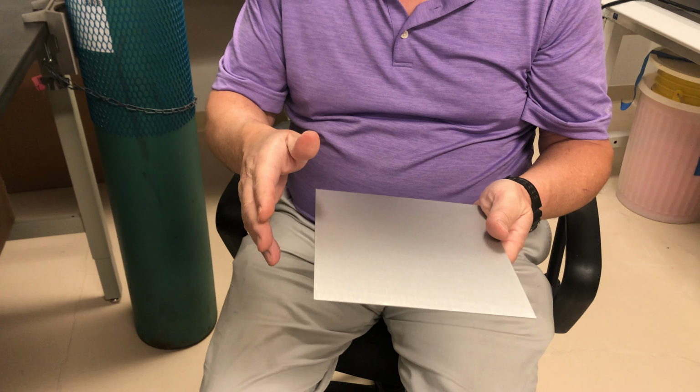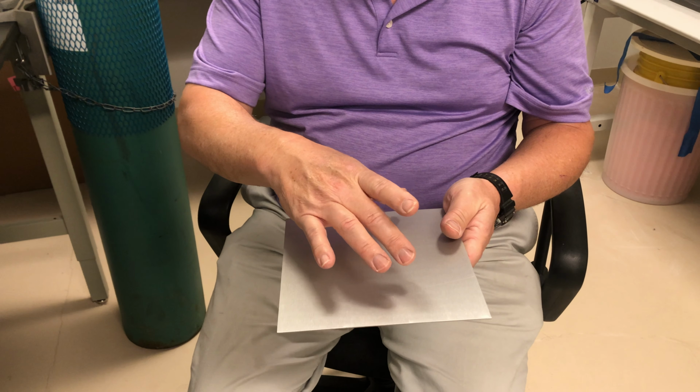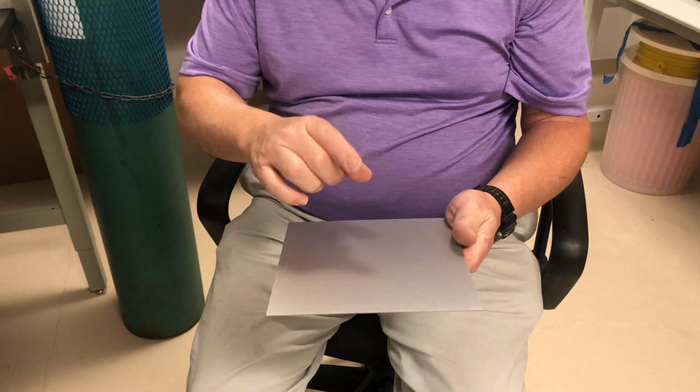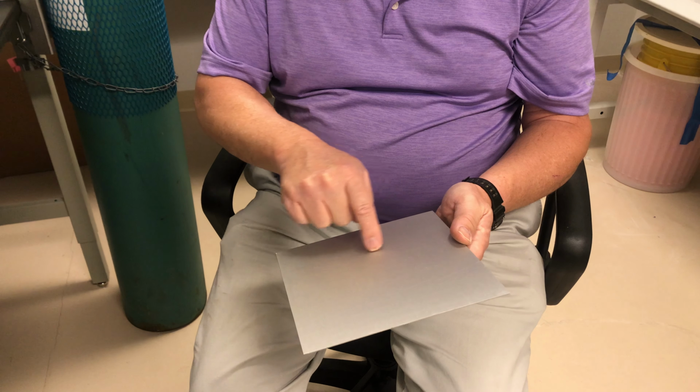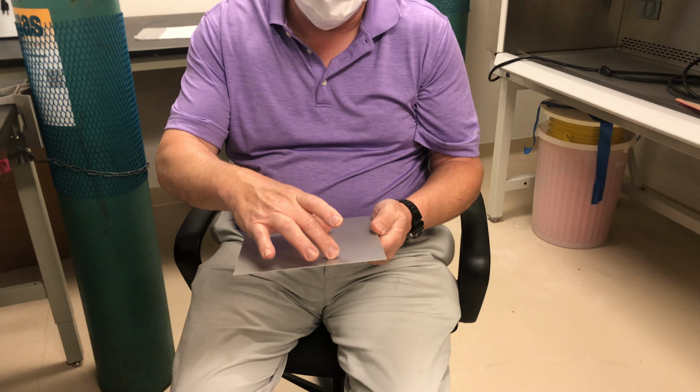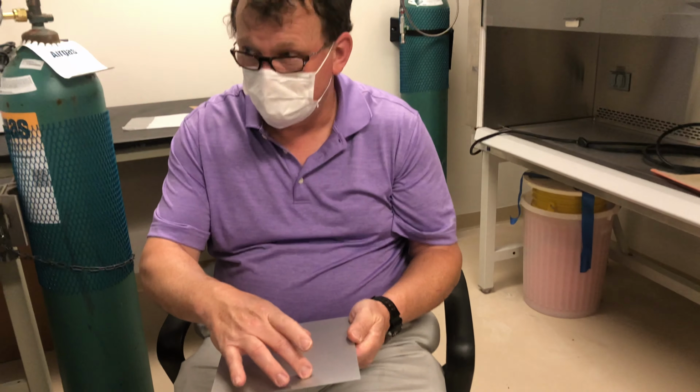If you have glass, you don't necessarily need the carrier plate. What I recommend for people who are using smaller plates is to make a line here, say at 50 millimeters, and then put your plate down starting at that point.